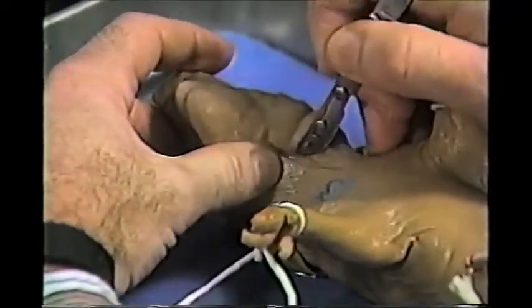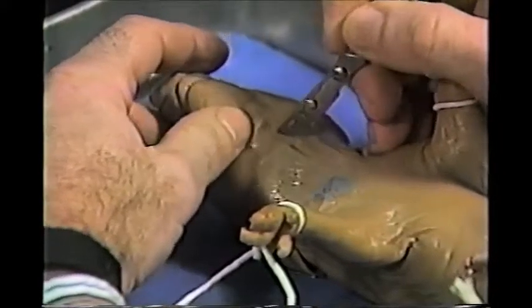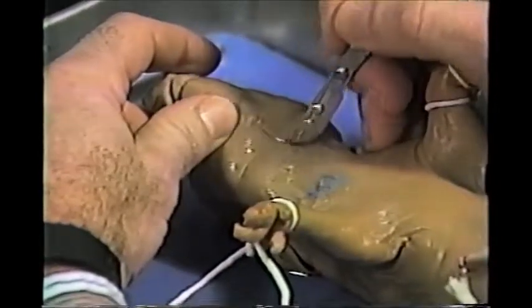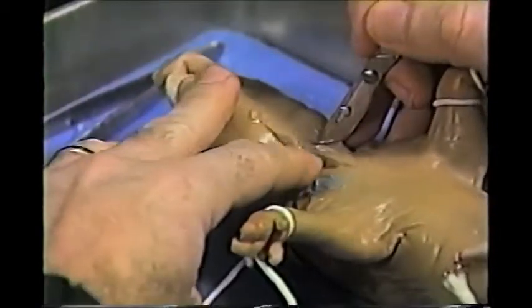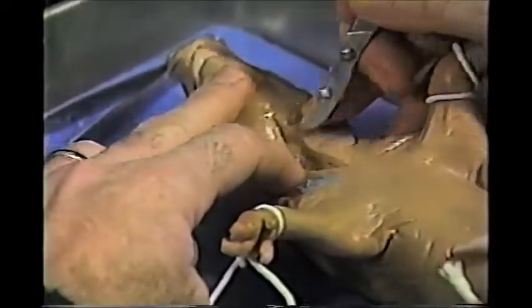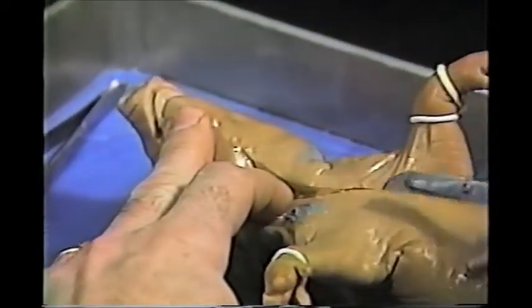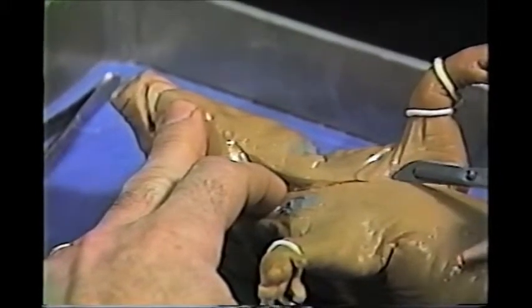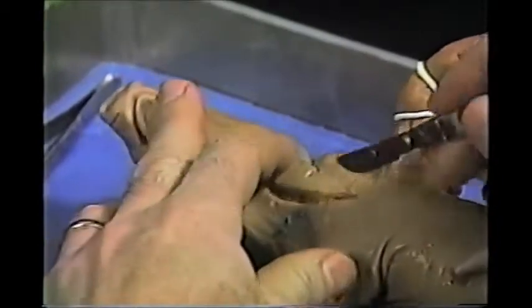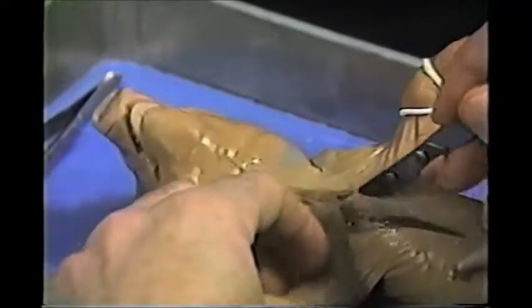Now you don't want to cut too deep and cut into the larynx or voice box or the trachea. Now there's a lot of muscle here, so that's fine. And you can separate this using your gloved hand or your forceps. When you get to the chest area, you want to cut to one side of the sternum or the other and cut through the ribs. So now you want to cut a little deeper and cut into the chest cavity.